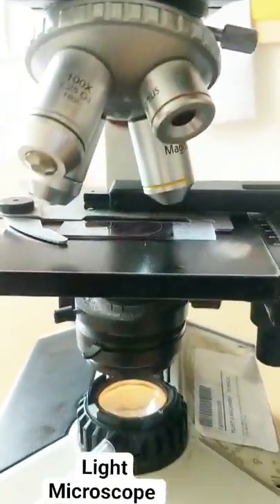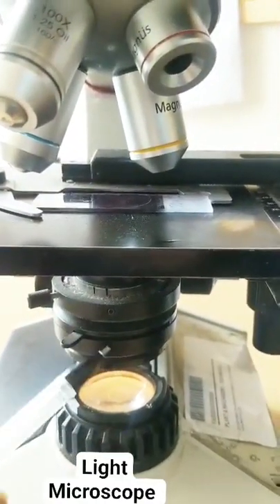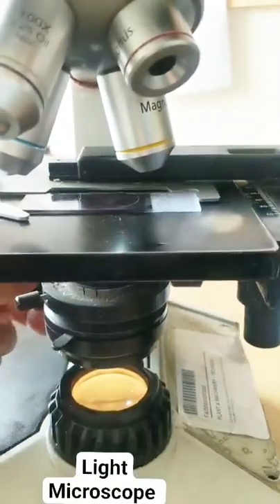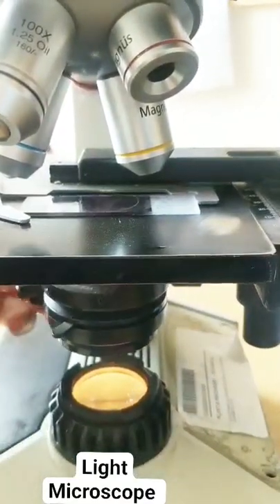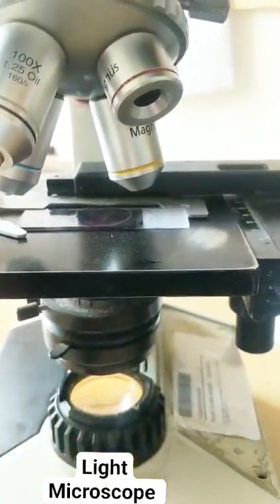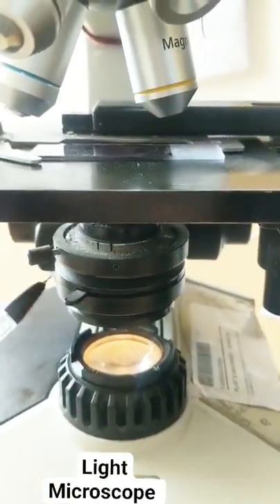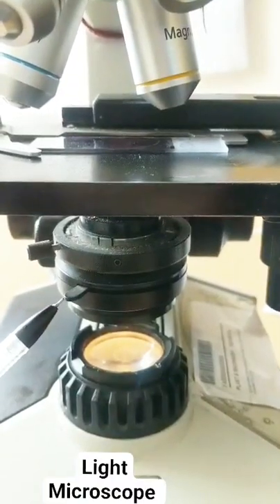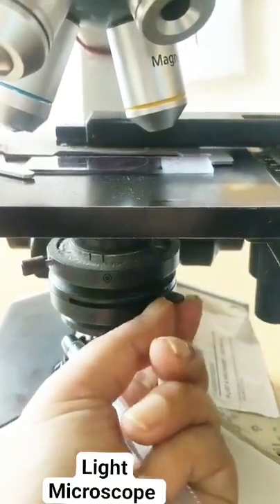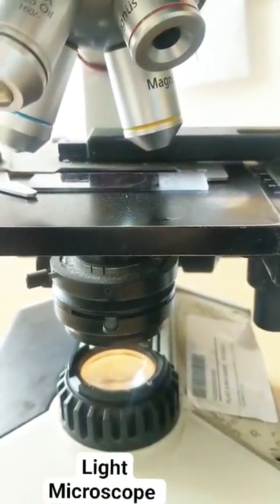What does the light pass through? This particular part is the condenser. I can move the condenser up and down, and with this knob I can adjust the amount of light entering. This becomes the iris — there is an iris present. So this full thing is a condenser, and then there is an iris that helps regulate the amount of light entering.